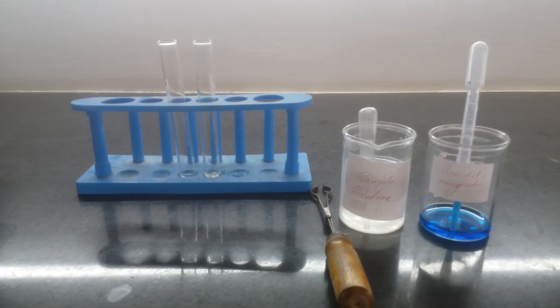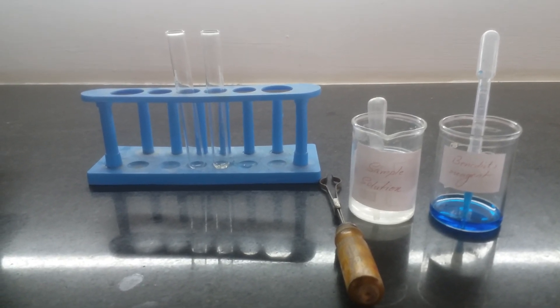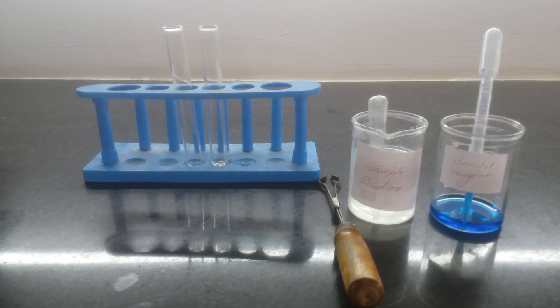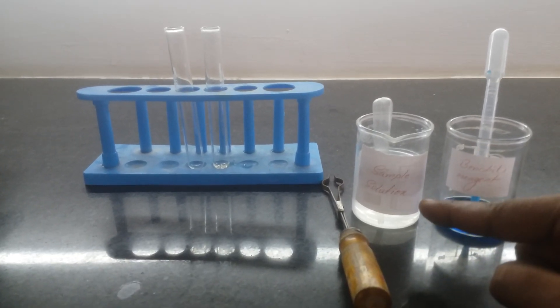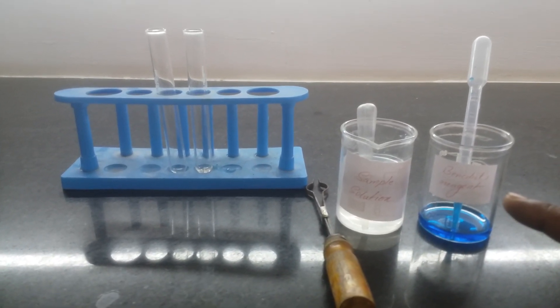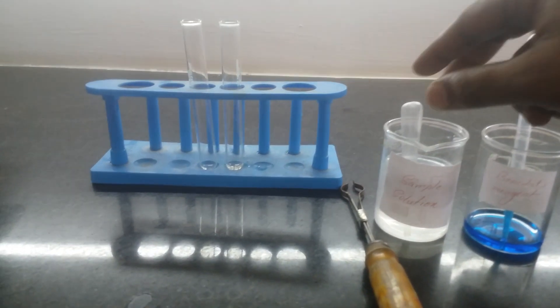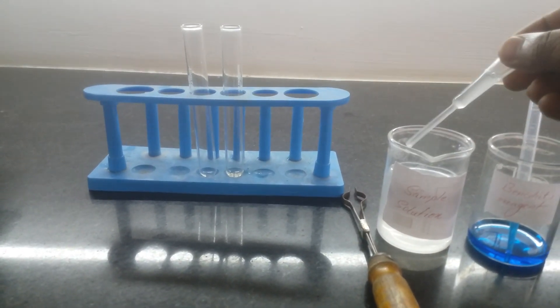The Benedict's test is a chemical test used to detect the presence of carbohydrates in a sample solution. For this purpose, we need Benedict's reagent. Let us perform this test.